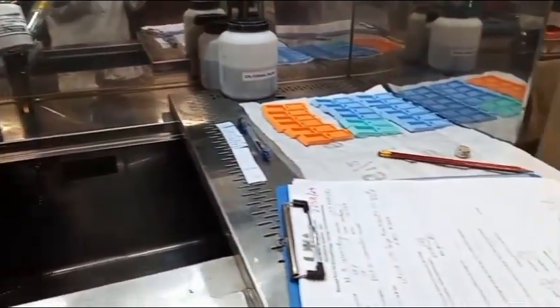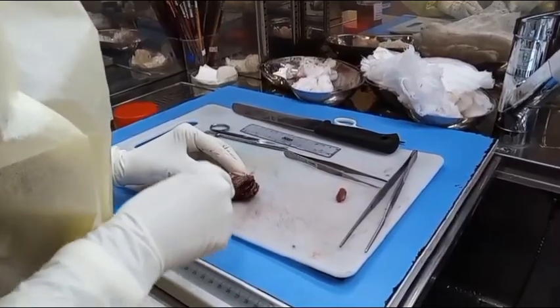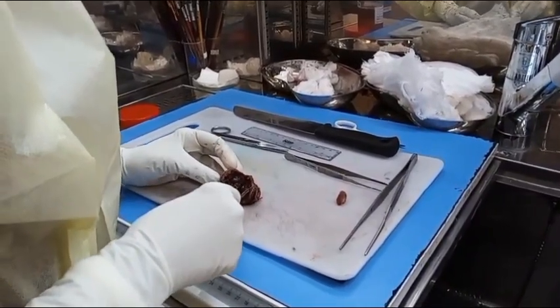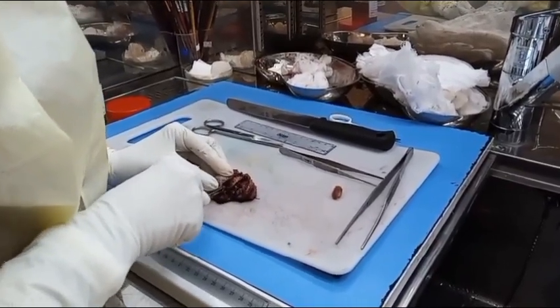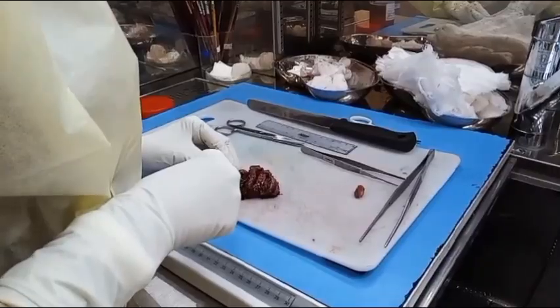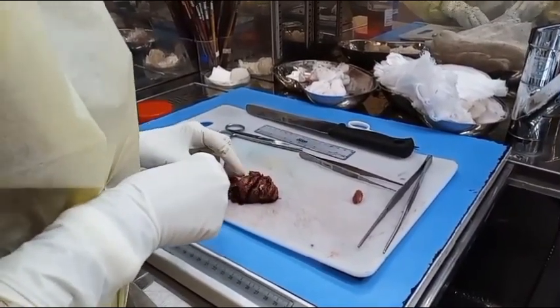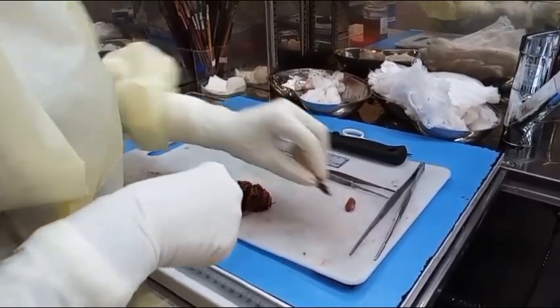Each specimen request form and the specimen container label should be checked to see if the information correlates. One specimen should be opened at a time during the cut-up to prevent specimen mix-up. If a dictaphone is not available, the MLT should assist the cut-up by taking down the macroscopic information dictated by the doctor. The instruments used for the cut-up should be sharp, and tissue obtained should be handled gently without crushing or squeezing with the forceps.